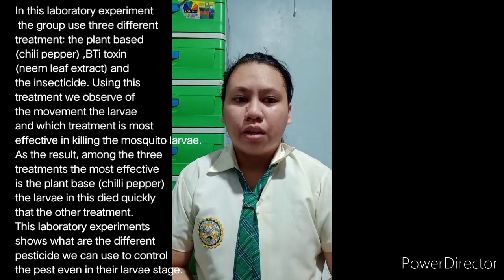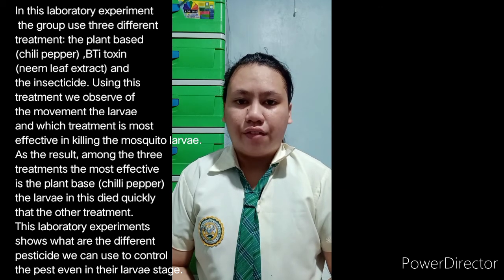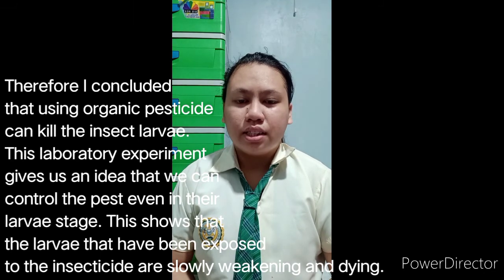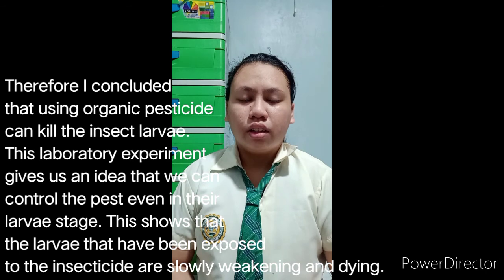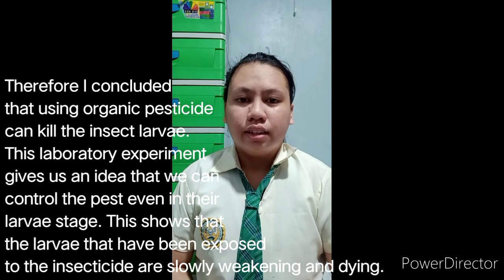The laboratory experiment shows that different pesticides can kill or control pests even in the larvae stage. Therefore, I conclude that using organic pesticide can also kill insect larvae. It also gives an idea that we can control pests in their larvae stage. This laboratory experiment also shows us that larvae exposed to insecticide or organic pesticide slowly weaken and eventually die.